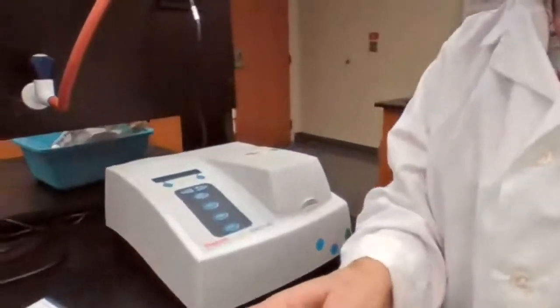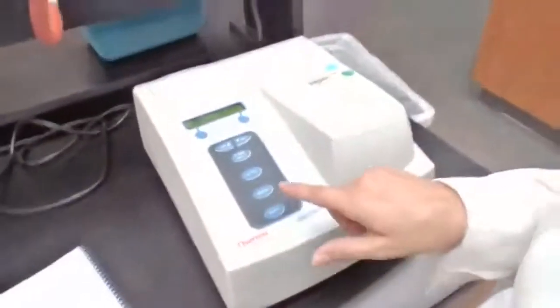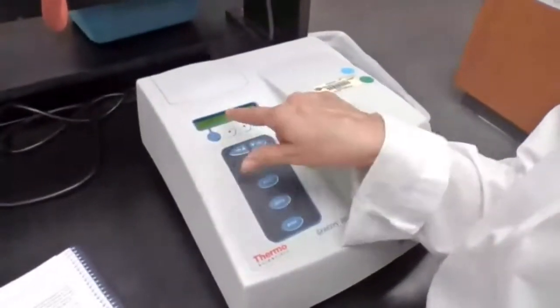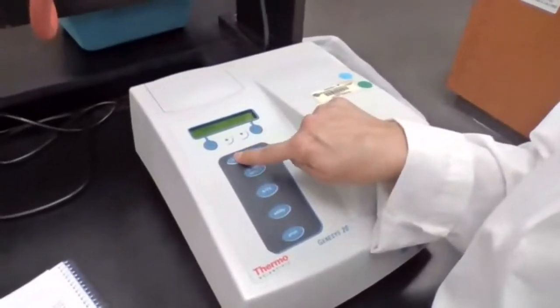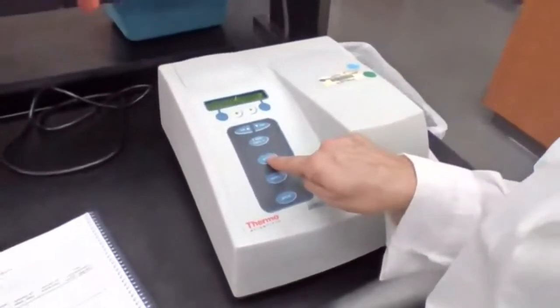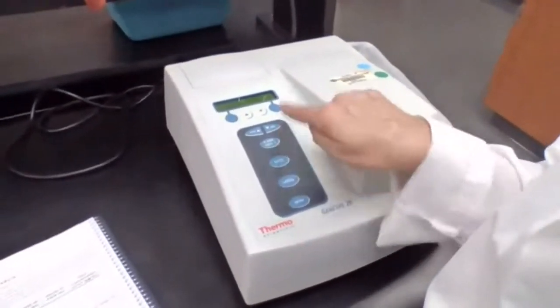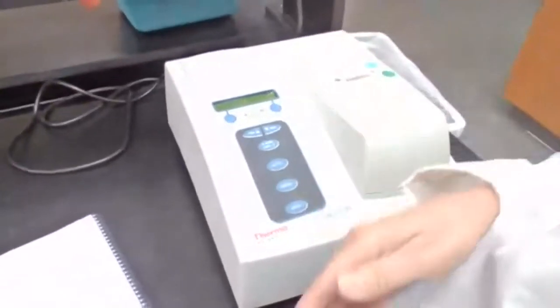This part of the experiment lets us change the nanometers — we can increase or decrease — and the procedure says to set it at 480 nm. I set it to 480 and I'm showing how to go up and down to reach 480. Then it says to use the ATC button — the concentration, absorption, or transmittance button — to change it to percent T. You can cycle through concentration, absorption, or percent T, and we are keeping it at percent T.